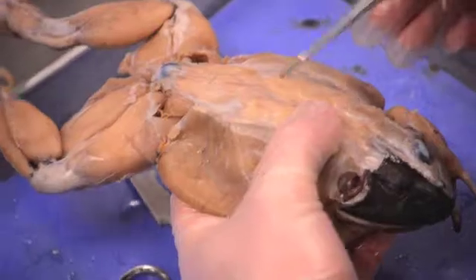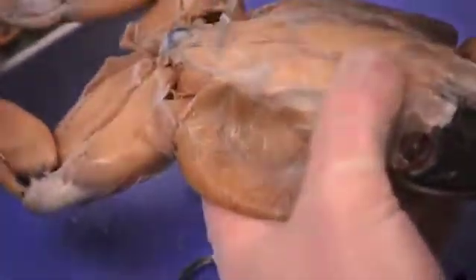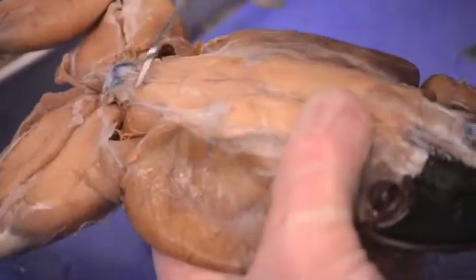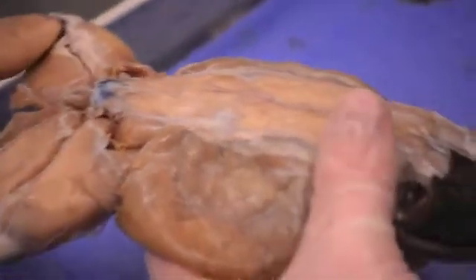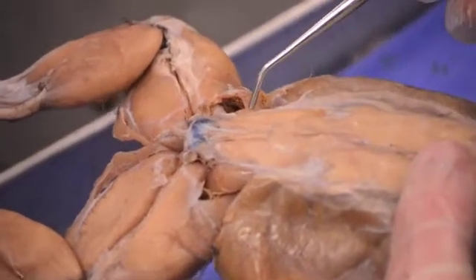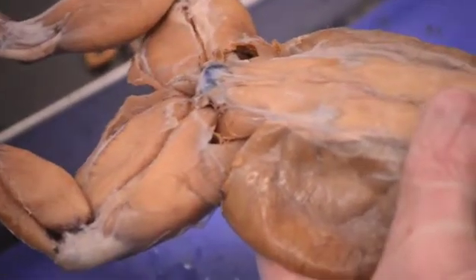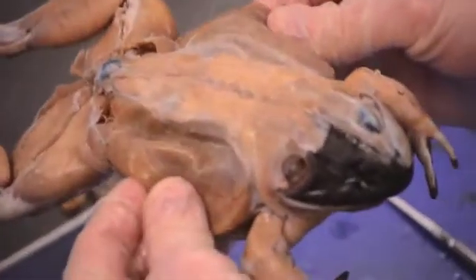Below the latissimus dorsi, we have some large glute muscles. There's kind of a big V shape here — that muscle is called the coccygeoiliacus. That name makes sense because it goes from the coccyx to the ilium. On either side of the coccygeoiliacus are the gluteus muscles — or just the glutes. The sides of the frog are the external obliques, the side ab muscles.